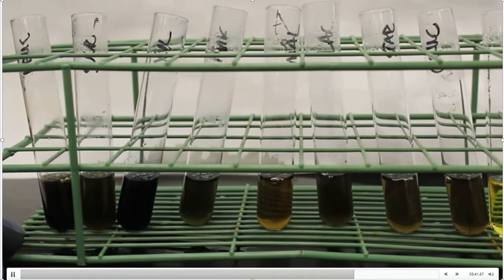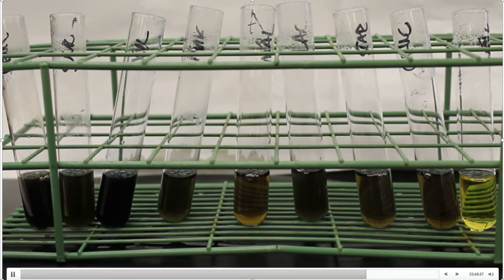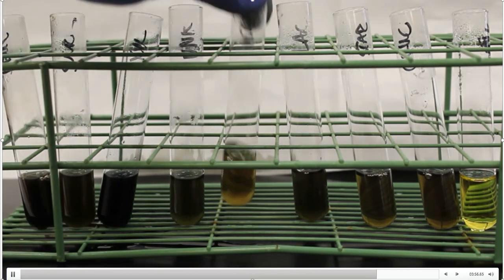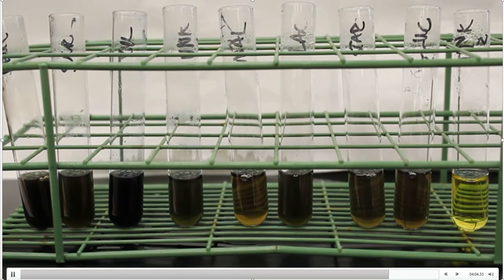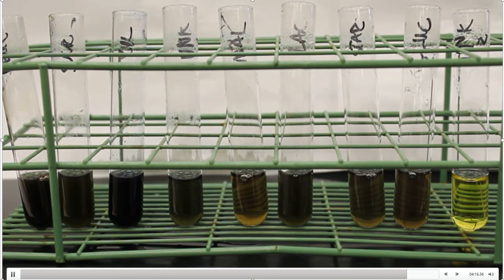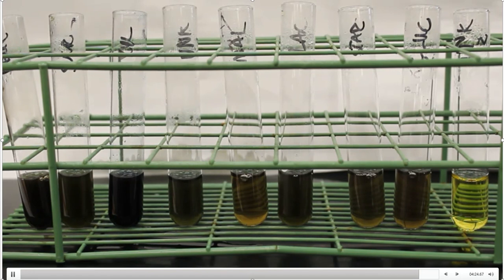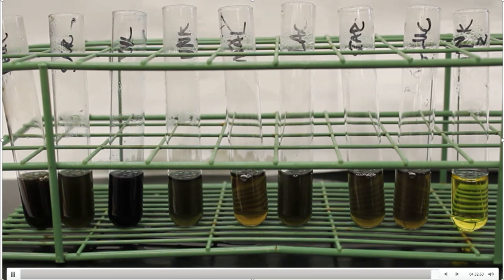So here are the color changes. I do apologize for the way that they look — it will be difficult to see on your computer screen depending on what kind of screen you're looking at. So fructose, sucrose, xylose, unknown number one, maltose, lactose, starch, glucose, and unknown number two at the very end — those are the orders of how we took them out and put them in. You're looking at colors, observations, blue-green versus brown-gray. I'll take some close-up snapshots so maybe you'll see them a little better. So that's it — the qualitative tests. Fill out your data sheets, write down your observations, make your determinations, answer those questions, and turn them in.